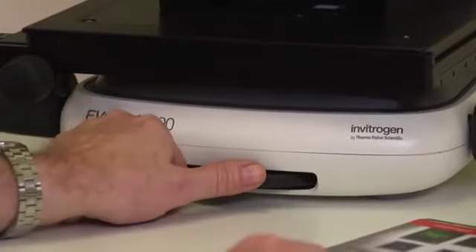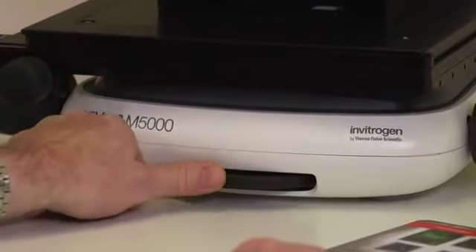Okay, now I'll take you through a simple 3 fluorescence channel capture and overlay. So to do this, we've got our slide mounted on the stage here. We have the objectives below the stage that can be selected by using this wheel. And as I switch between positions, it updates and tells me which objective is in which position here.